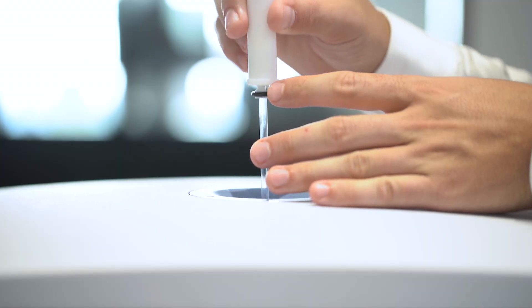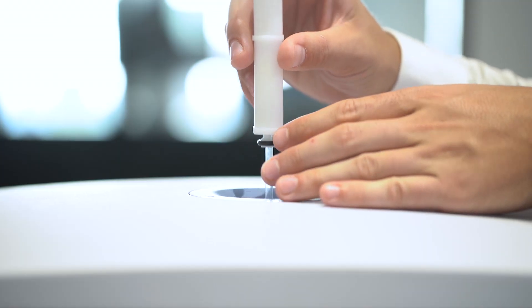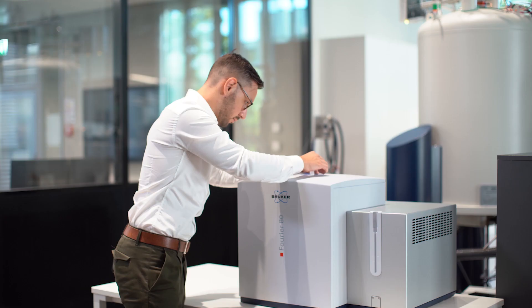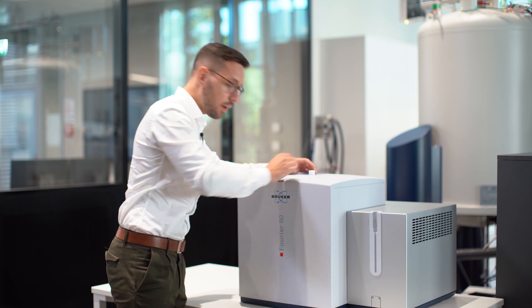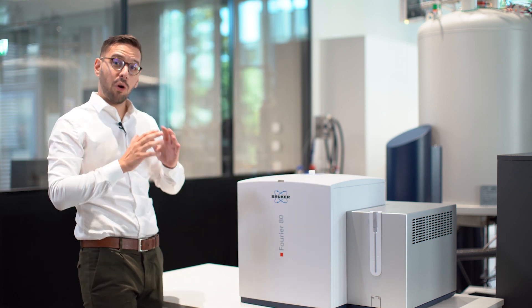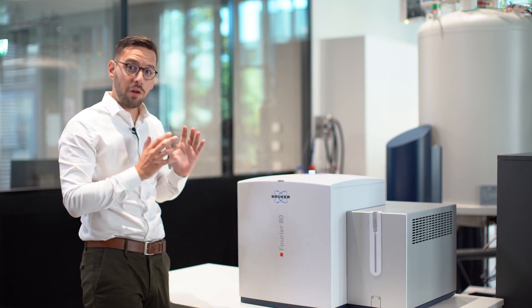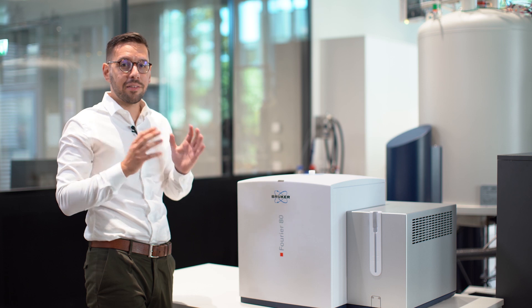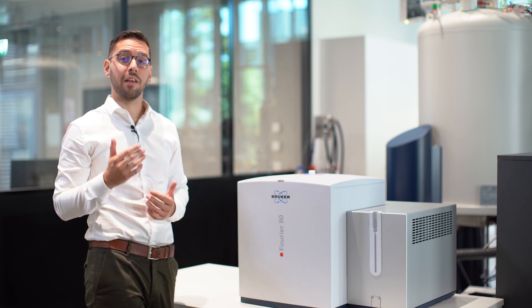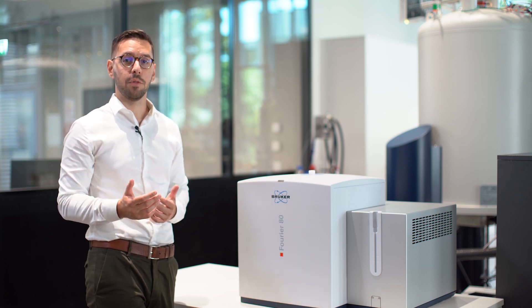Be careful at this point not to force it too much to prevent damaging the instrument. And that's it — that's the whole interaction the student will have with the instrument. You can see the risk of damaging the instrument is very, very low.